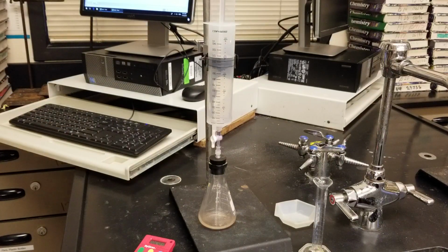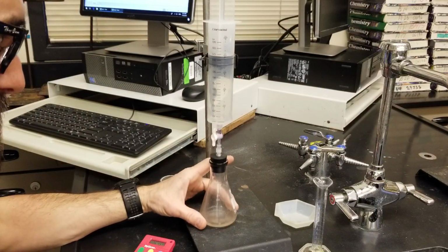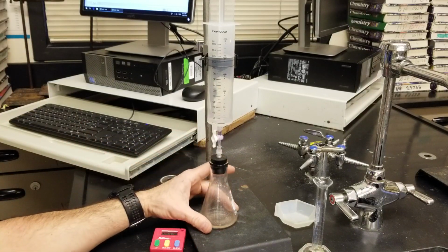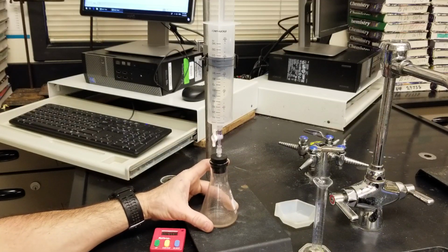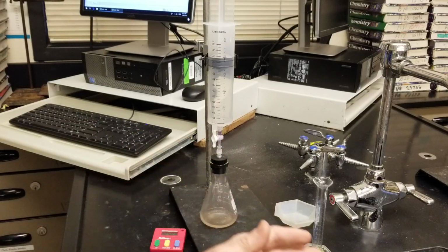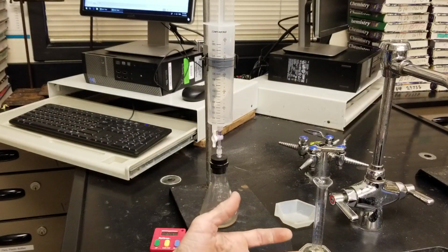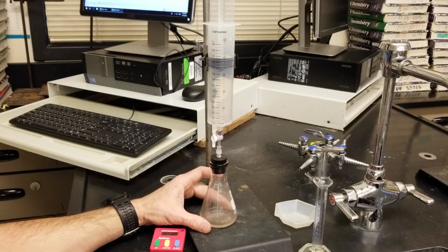Now, for me, at about the 6-minute mark, I notice I'm no longer making any gas in my reaction vessel. So at that point, you can make a call. If you shut it down at this point, then you risk maybe not completing the reaction. But what's most important when comparing the effects on reaction rates of changing temperature or concentration, like this lab is asking you to do, is initial rates.